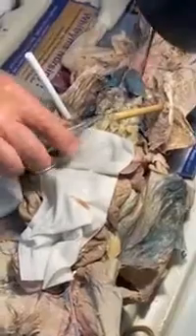Okay. I even left the lungs in for you guys. Usually they all cut them out, but that's the lungs. Lungs are very vascular too. Well, that kind of makes sense. What we're doing, we're oxygenating blood. And so that's why they look blue like that. When they injected the blue dye in the vein, it all collected underneath there. Lungs, there's your heart.